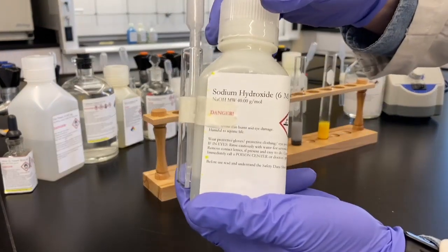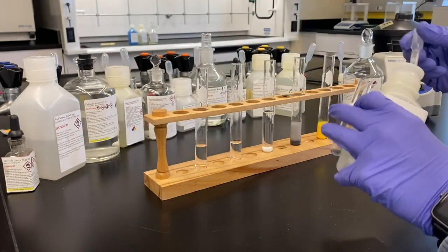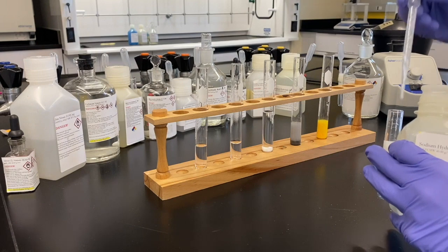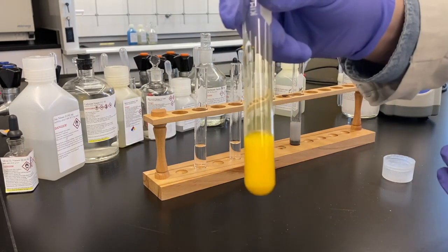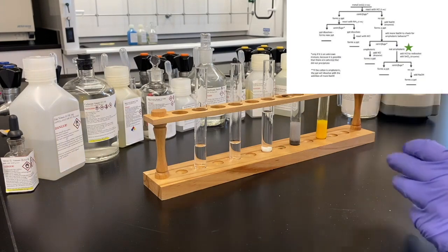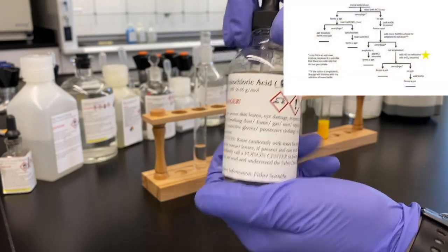Now again, upping the ante to see if this is an amphoteric species as well. If it's amphoteric, it will react with more base. We know that we could add acid to get back our aqueous solution. If we can get that aqueous solution from adding base as well, then it's amphoteric. It's not the same. In this case, it's not. So, not amphoteric, we're moving down the right side of the second branch there.